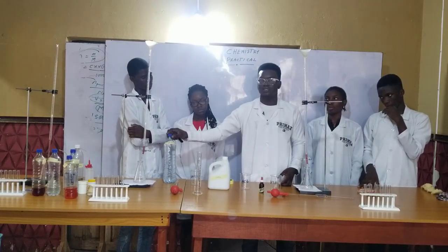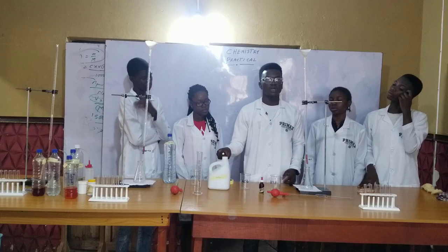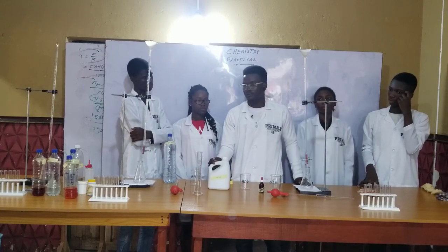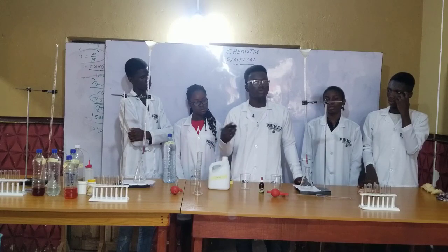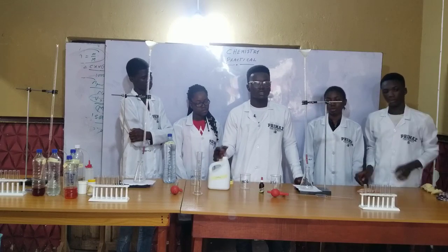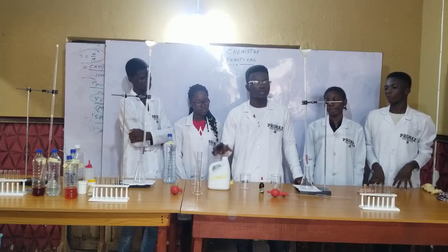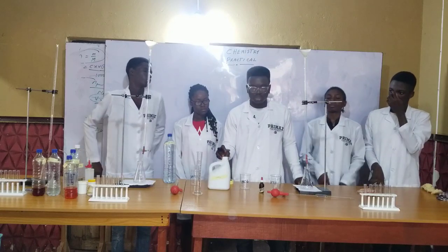We have a strong acid and a strong base, and for a strong acid and a strong base, you can use any suitable indicator. As long as it is a strong acid or a strong base, we use any suitable indicator.